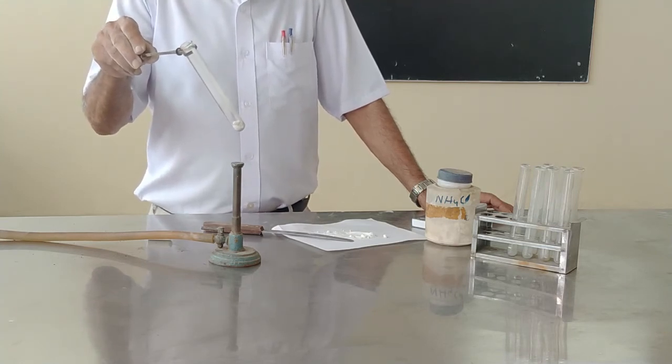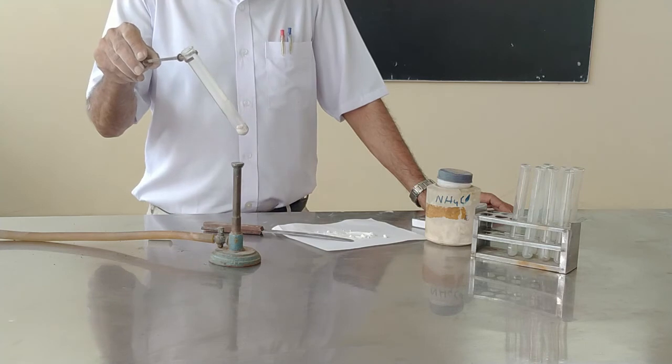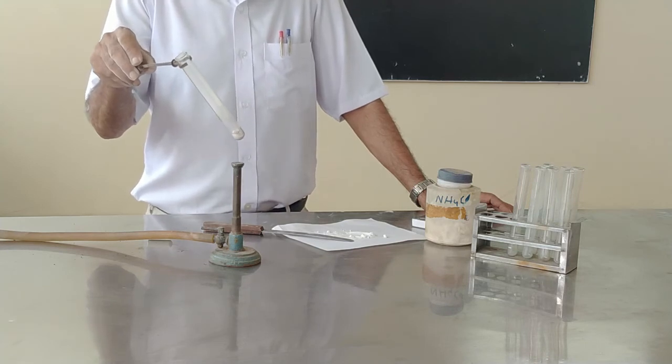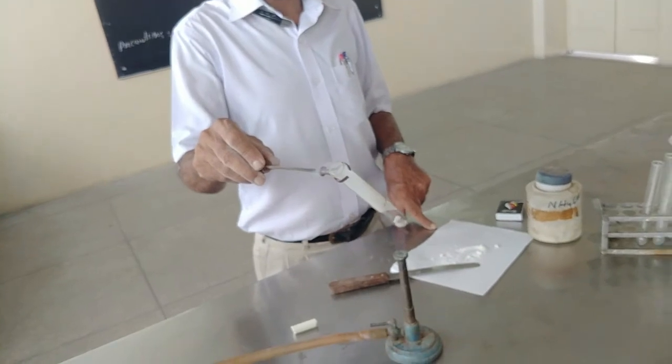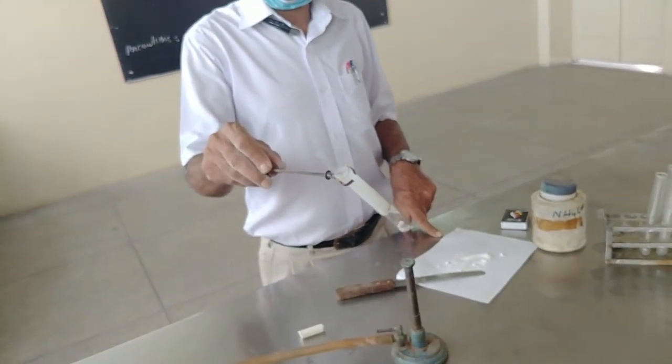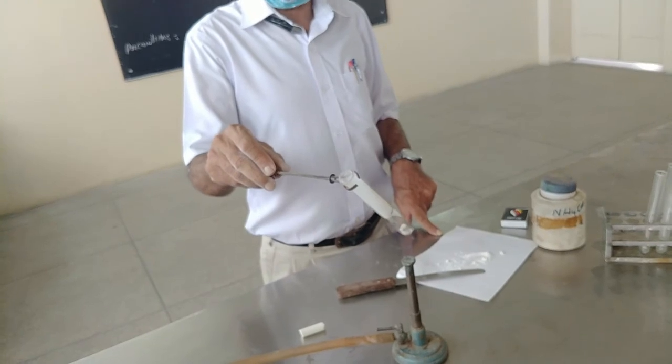No liquid is produced in this process. This is the sublimation process which we are demonstrating. In this process, vapors are producing in the test tube on heating of ammonium chloride.